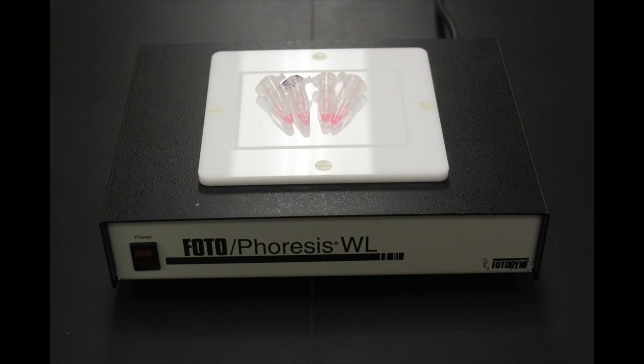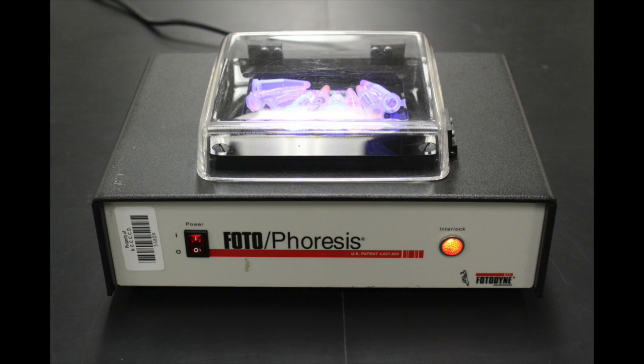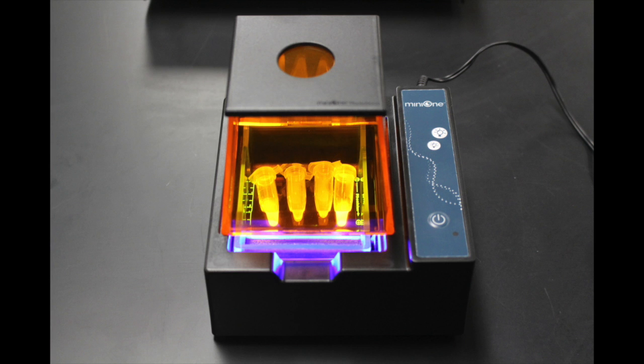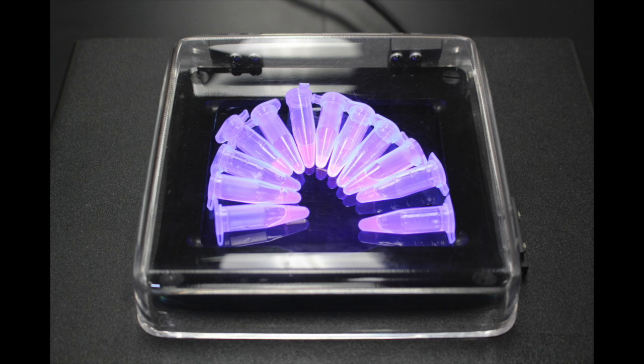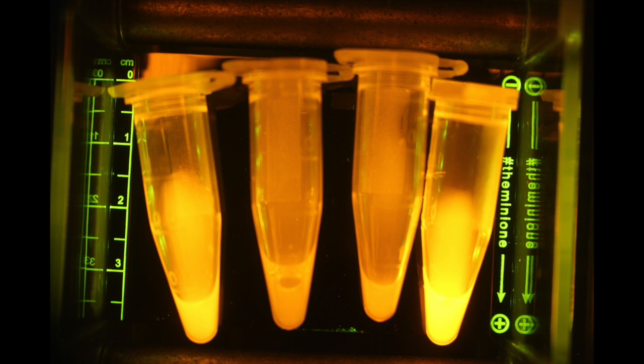You can look at the RFP in visible light, UV light, and blue light. Maybe your class can have a contest to see who did the best job in purifying the largest amount or most concentrated RFP. Have fun with this experiment.